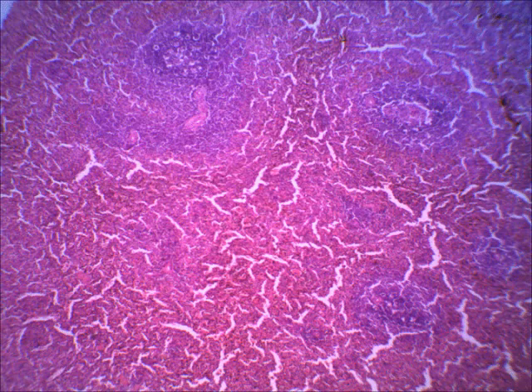Now, the spleen, if you remember from your lecture, the spleen filters blood, not lymph, whereas the lymph node filters lymph. But within the spleen, you still have these nodules or aggregations of lymphocytes, and because lymphocytes are white blood cells, in their natural state, unstained, unlike this slide, the white blood cells actually look white. So if you had a fresh spleen in your hand and sectioned it, you would actually see some little dots of white amongst all the red, and that would be the white pulp.